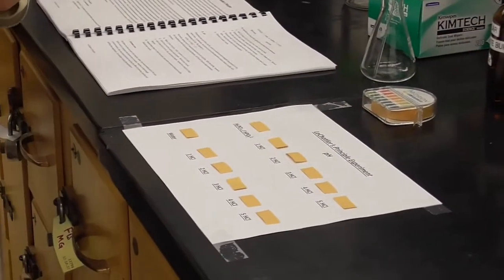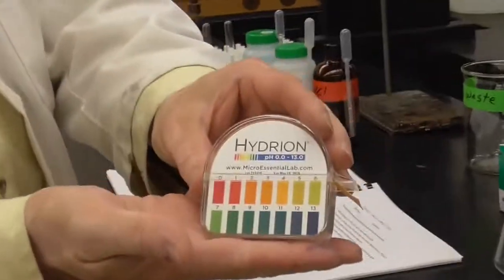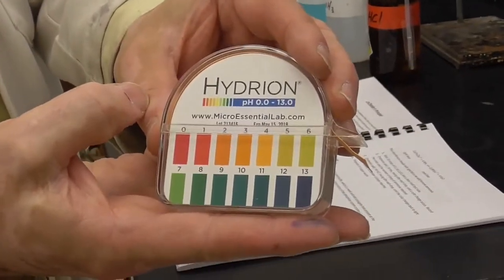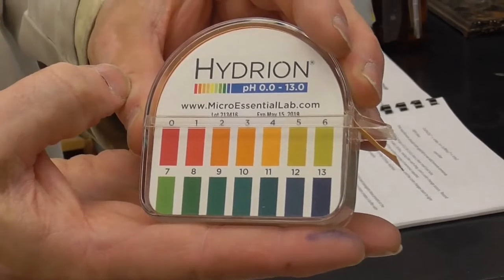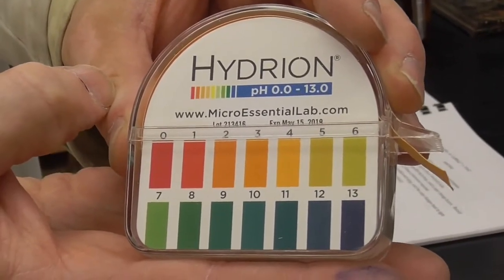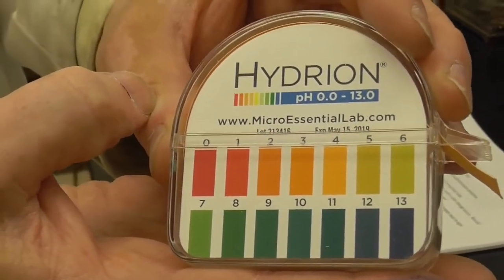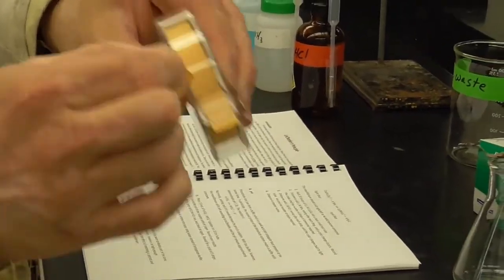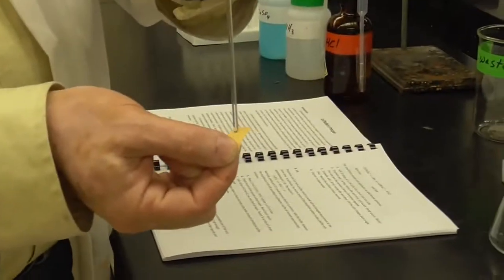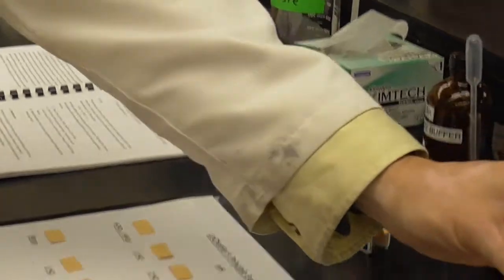All right, next check the pH of the solution with pH paper. All right, so we have our pH paper, which under different pHs, of course, changes color. And we see at the top there, 1 through 6, those would be the acids. On the bottom, 7 through 13, this one goes up to, those are the bases. Right. And as usual, to use this, you would tear off a little piece of paper and then have your solution, and you would touch it to the paper and see what color it changes. Okay, so we're going to do that with what we have in our test tube.